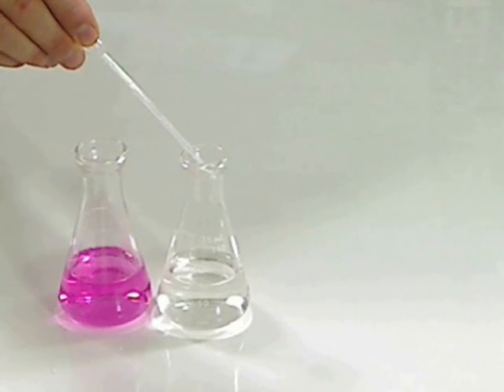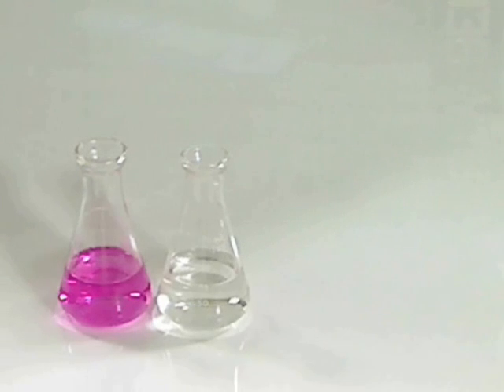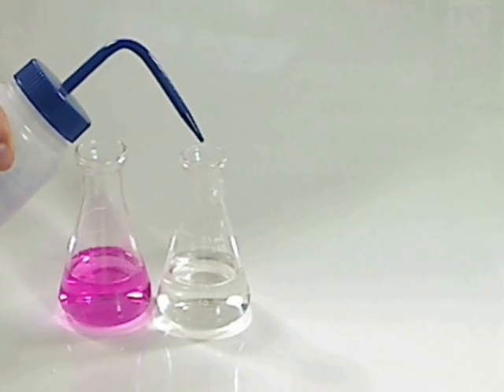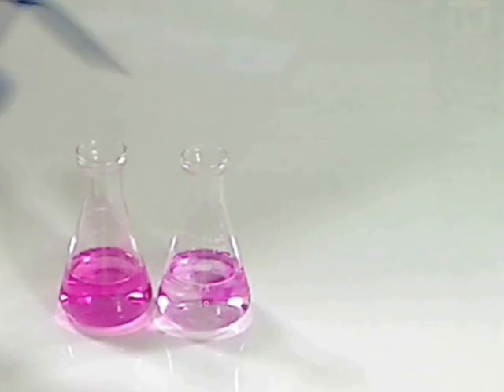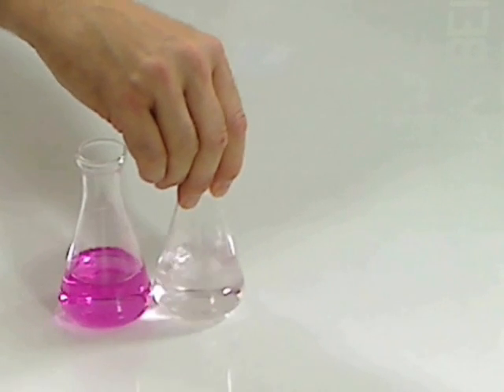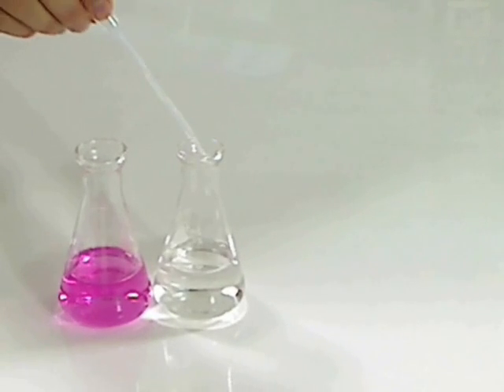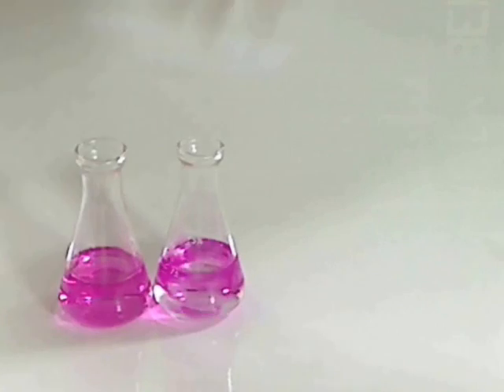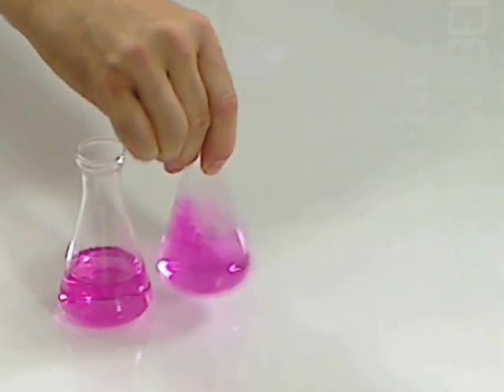The next partial drop is probably going to be my equivalence point. Wash that down. Still another partial. Titrations require patience.